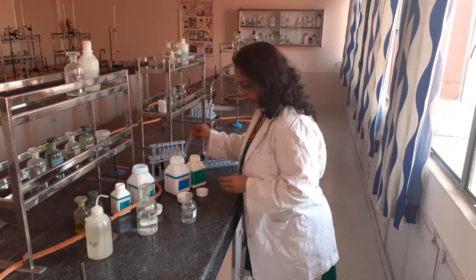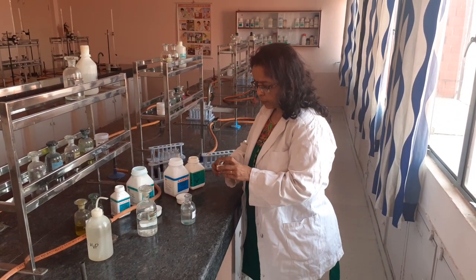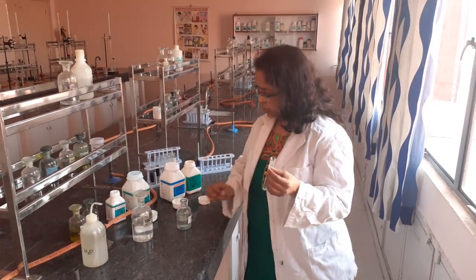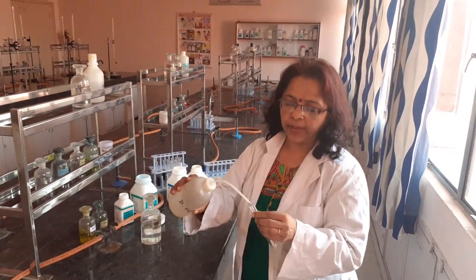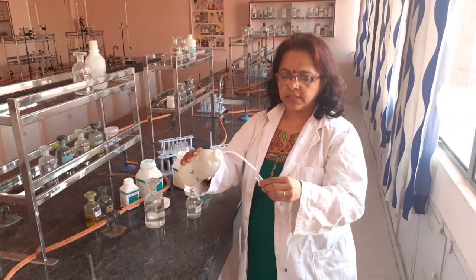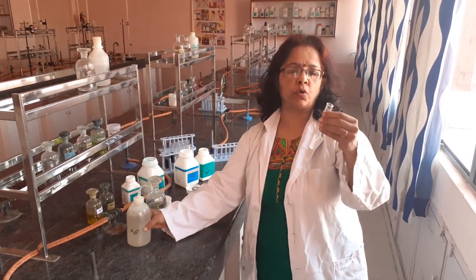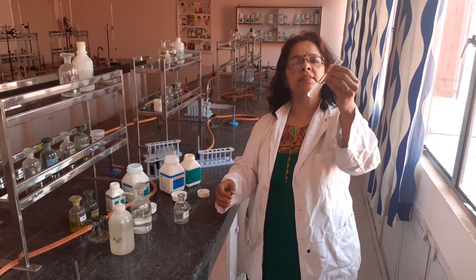So we will first do the test for Manganese. Take a pinch of salt — you can use a spatula. To the pinch of salt, add water to make the original solution (OS). That becomes your OS. Take a little pinch of salt; don't take huge amounts. Add water — this is clear.